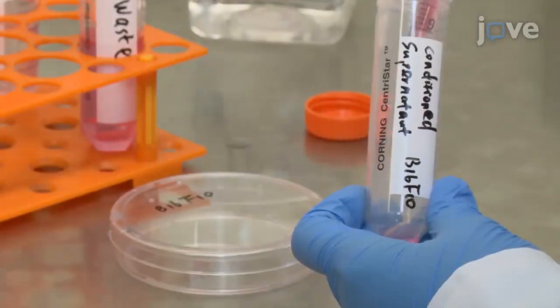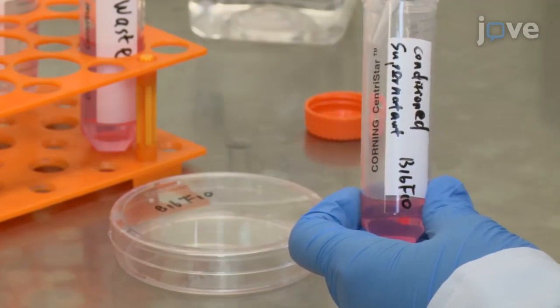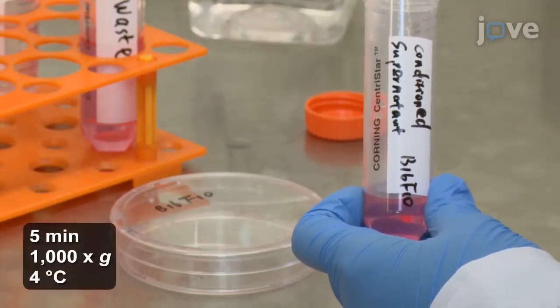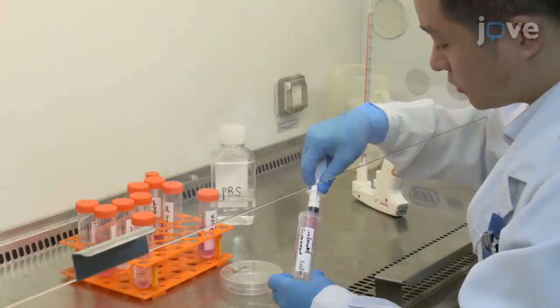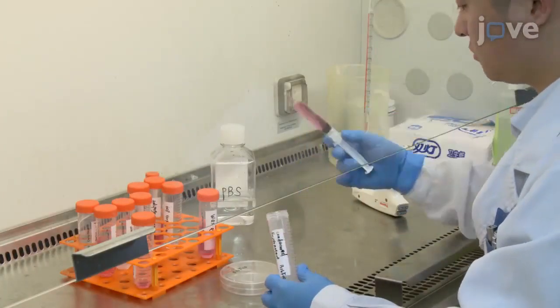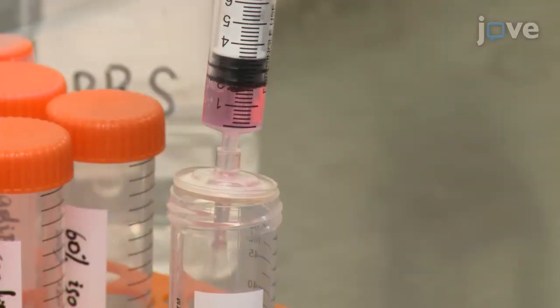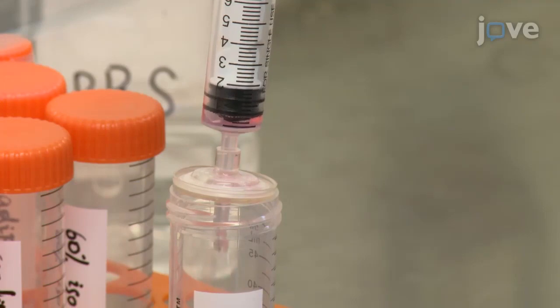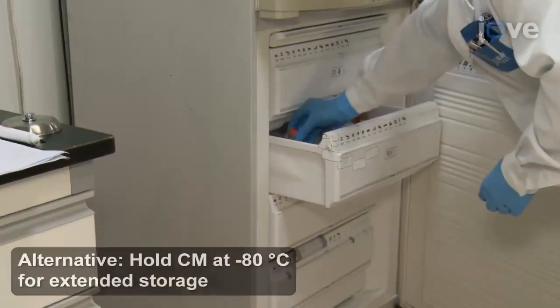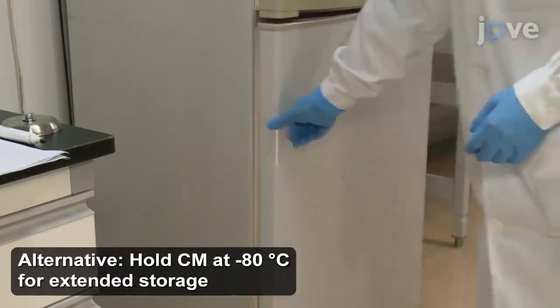The next day, use a pipette to transfer the conditioned supernatant into a 50 ml conical tube for centrifugation, and load the medium into a syringe equipped with a 0.45 micron pore filter. Then strain the solution into a sterile container to remove any remaining cell debris and store the conditioned medium at -20 degrees Celsius for up to 1 month.